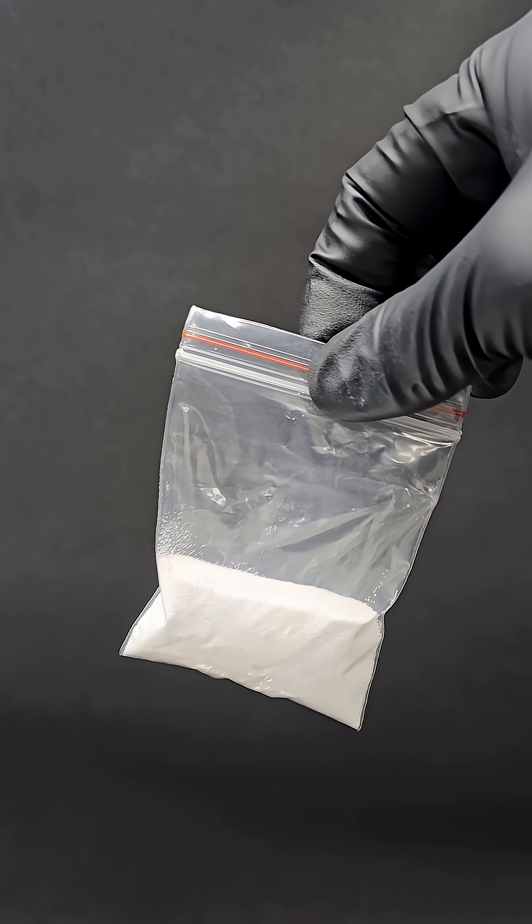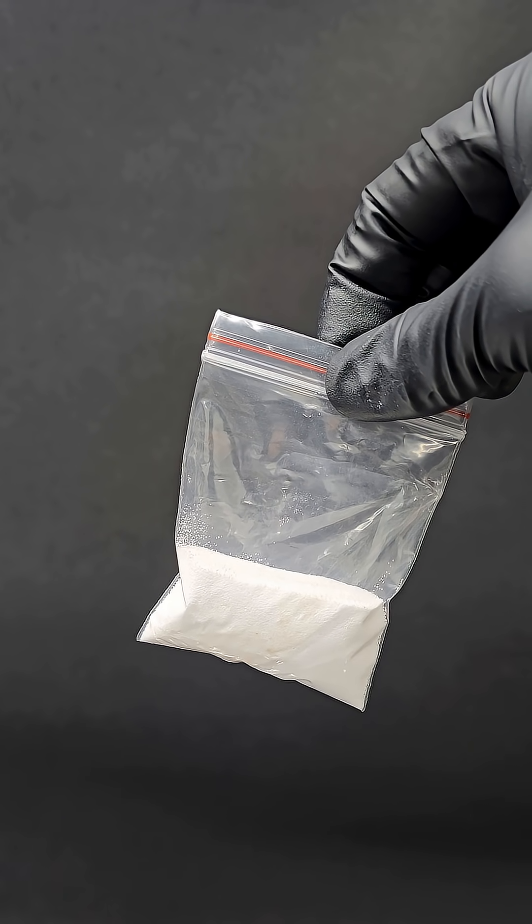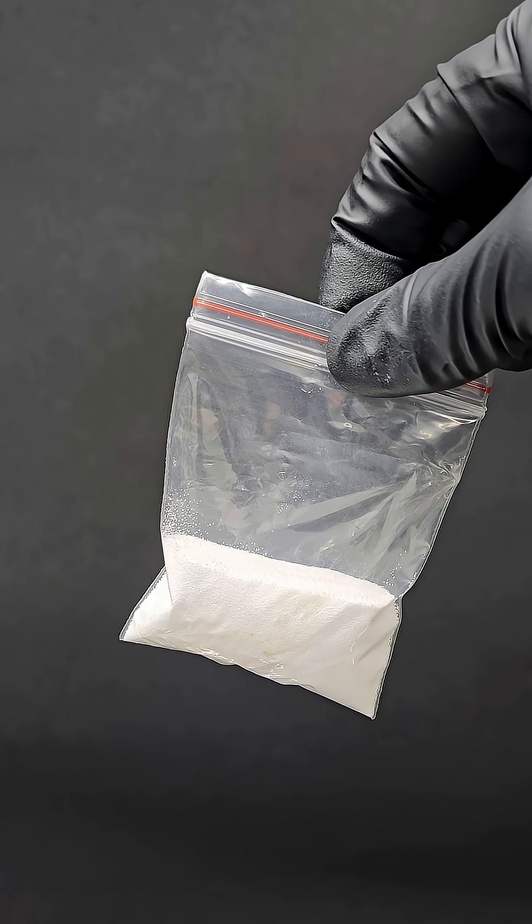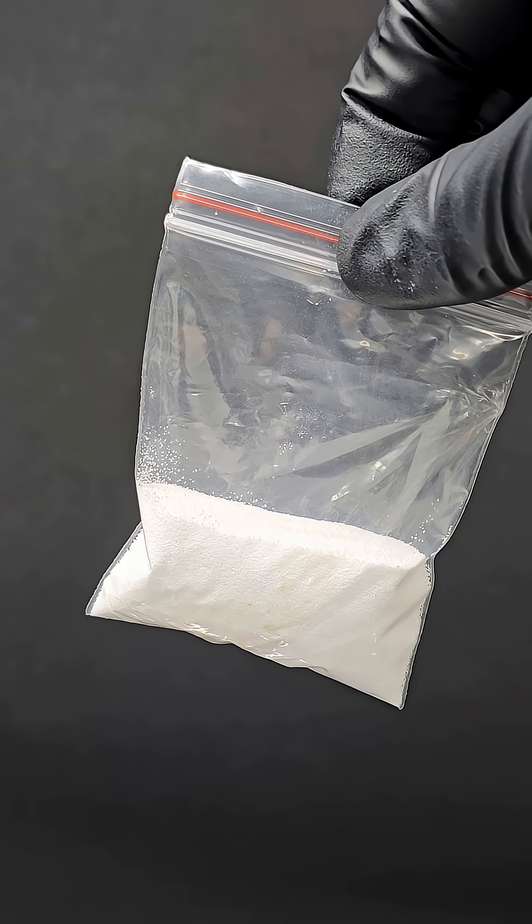What I have here is just a bunch of regular sand and I really want to try turning it into some spontaneously combustible gas.